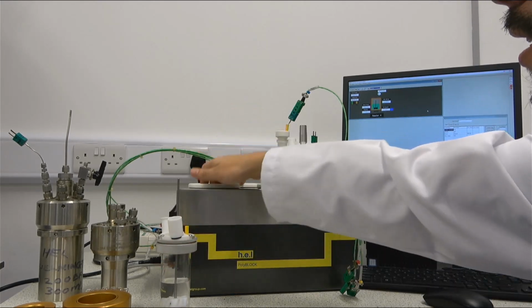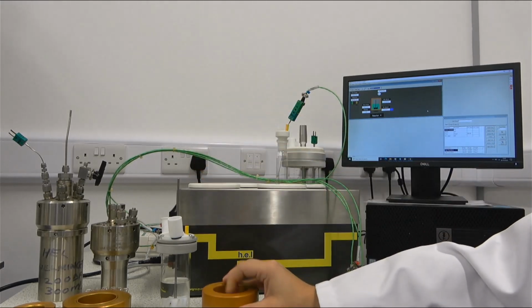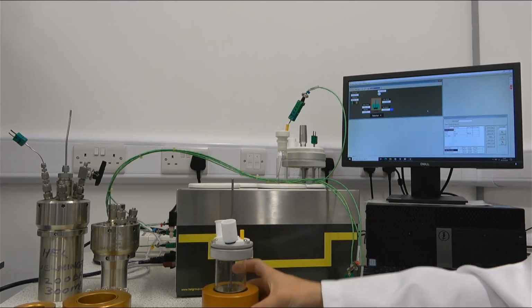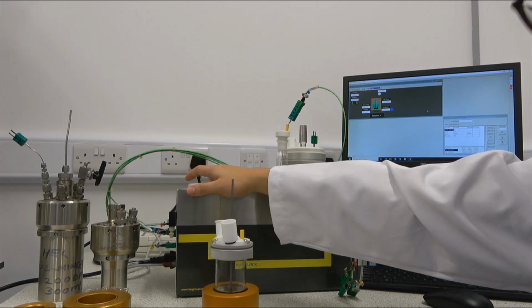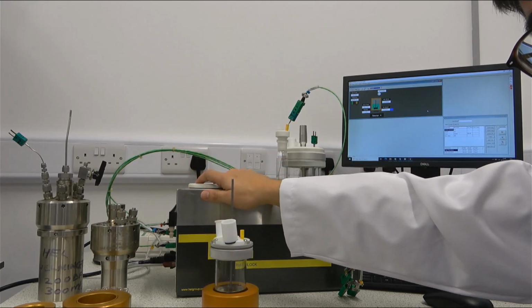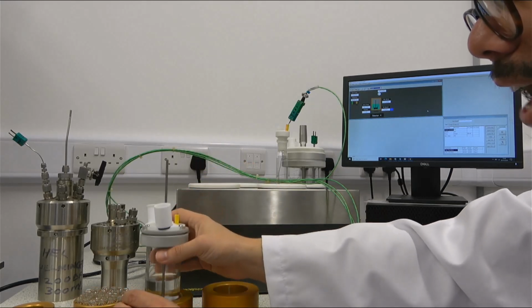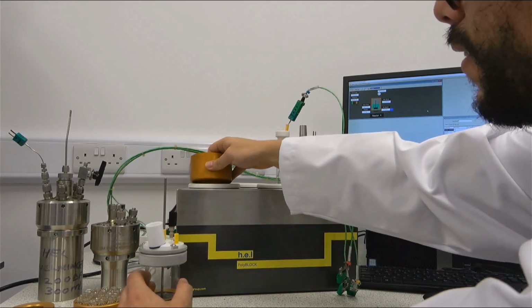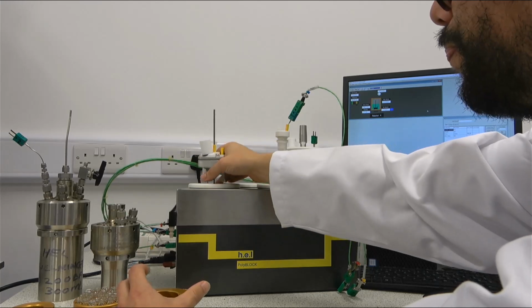All of this is achieved thanks to our adapters that, as you can see, completely engulf our reactors, and they are in contact with the metal inside of the PolyBLOCK, ensuring that there is this ideal heat exchange. So then they are as simple as just feeding them in like this.